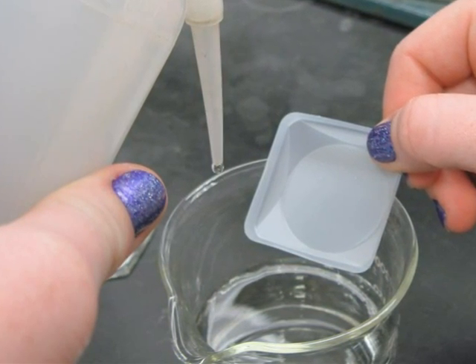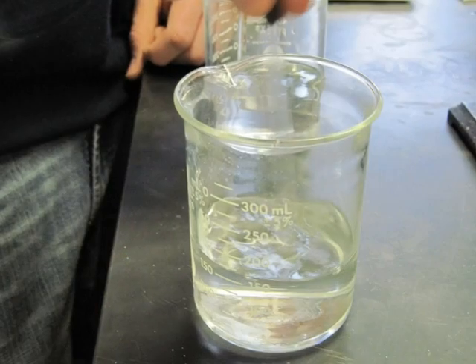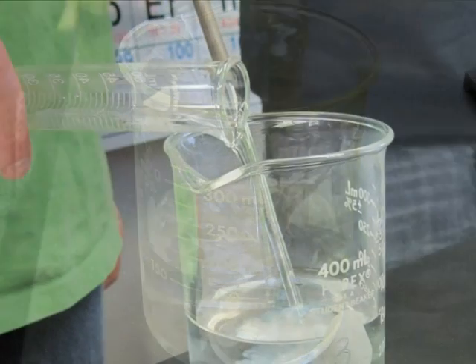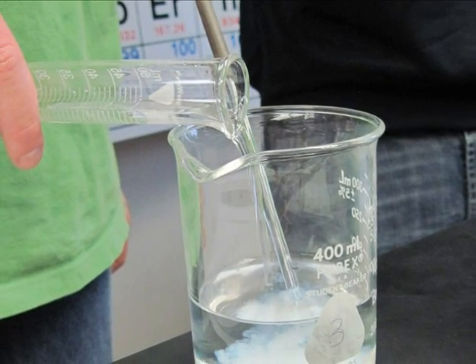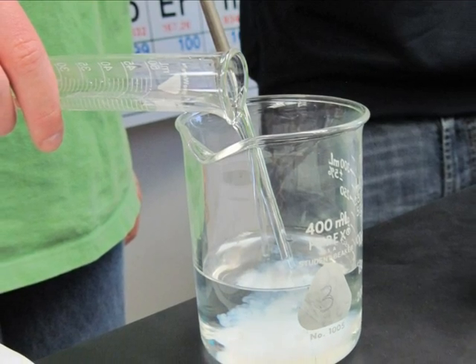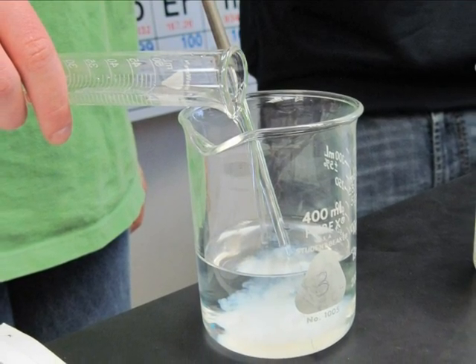Repeat with samples 2 and 3. Stir each sample with three different stirring rods to dissolve. Add 20 milliliters of 1.5 molar silver nitrate solution to each sample to precipitate the chloride ions.